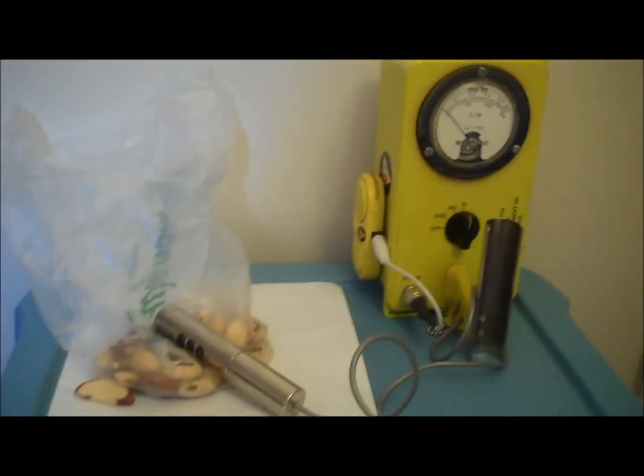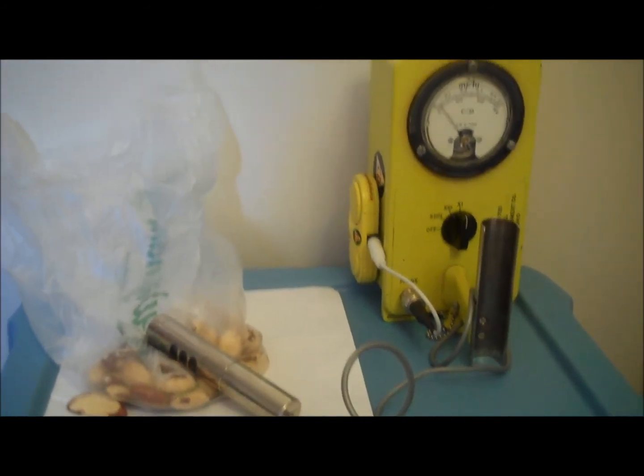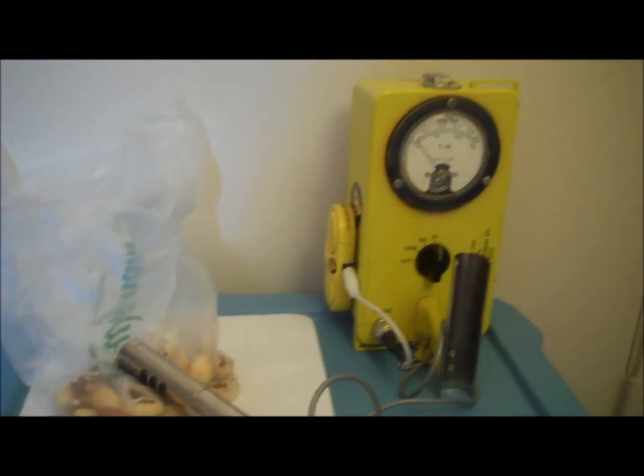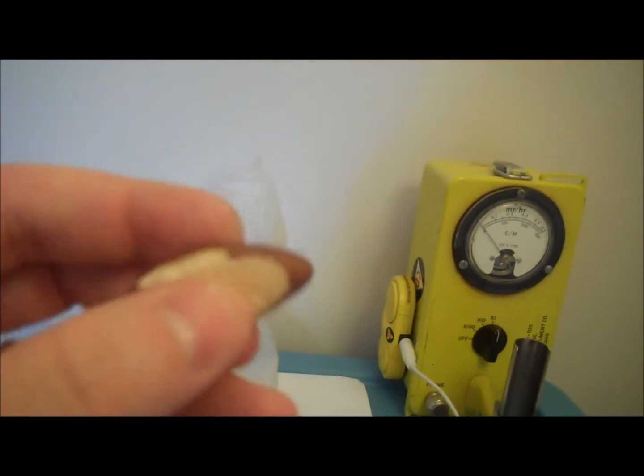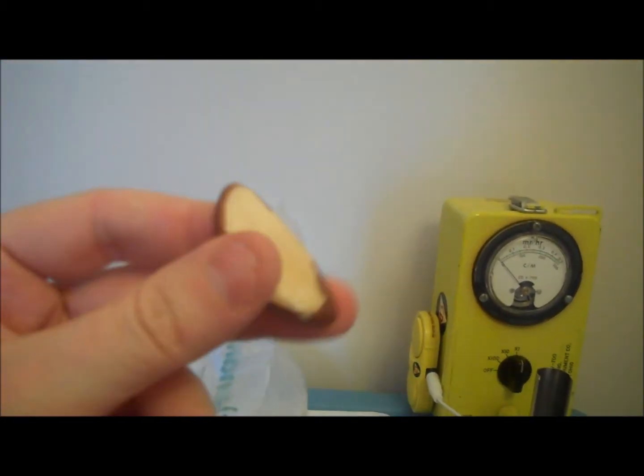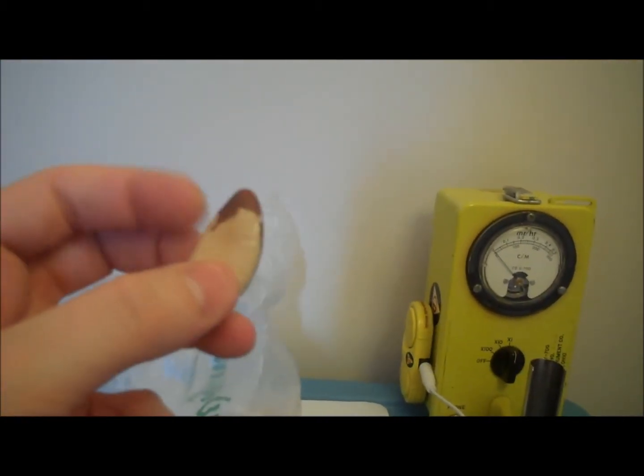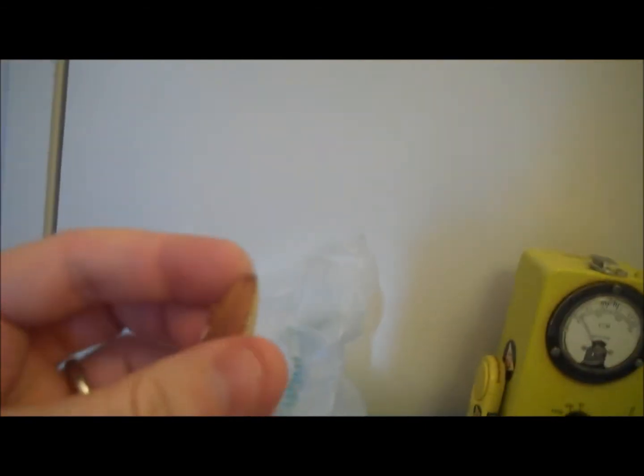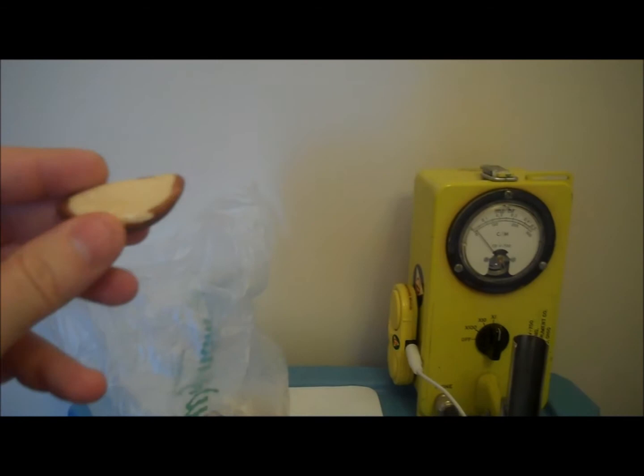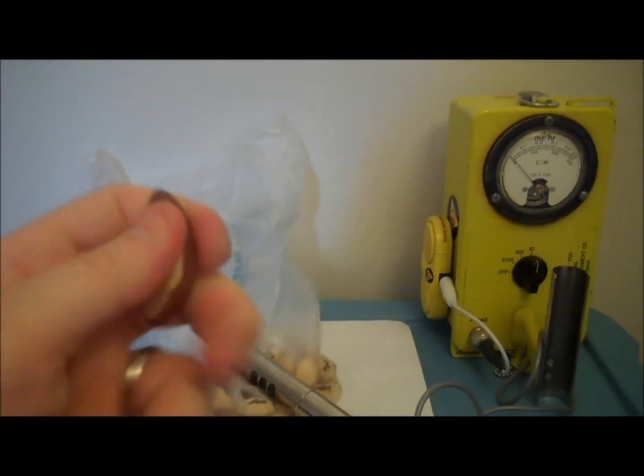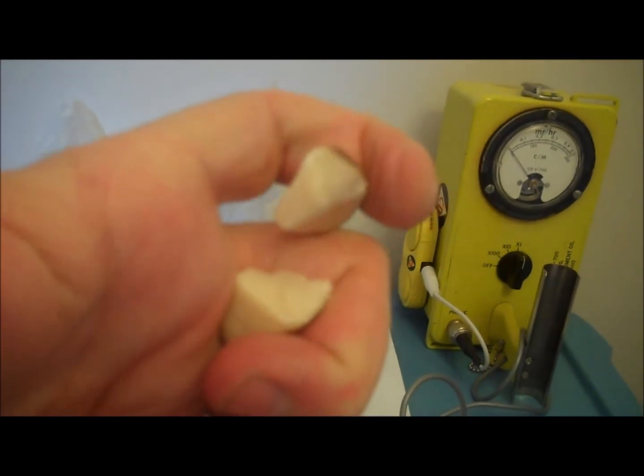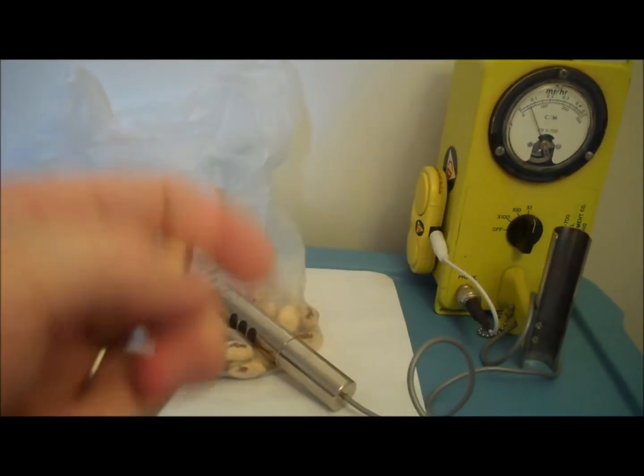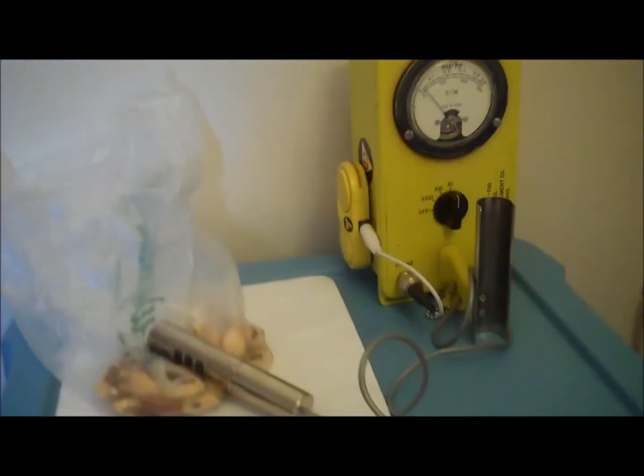We're going to have to put this in the gamma scintillator and do a little gamma spectroscopy to find it. I'm pretty sure that if we run this in the gamma scintillator for 24 hours, all those little gammas will come out and we will collect them. The gammas that we collect, their energy will leave a signature like a fingerprint. Perhaps we will detect radiation in the common everyday Brazil nut. What is inside a Brazil nut? Let's see.